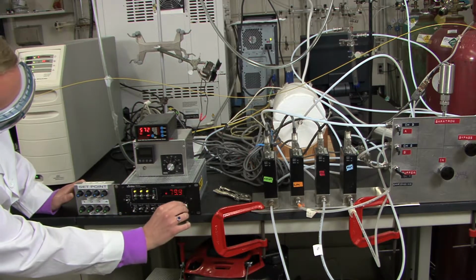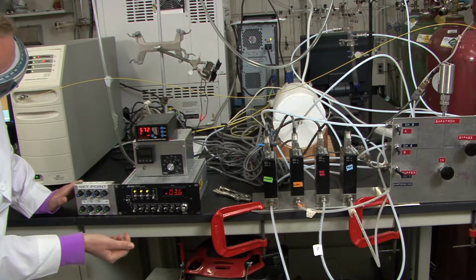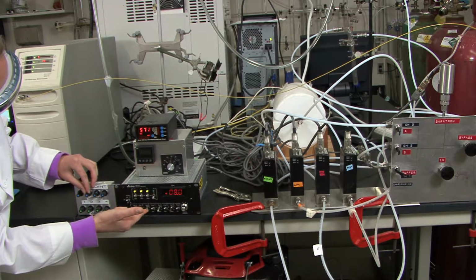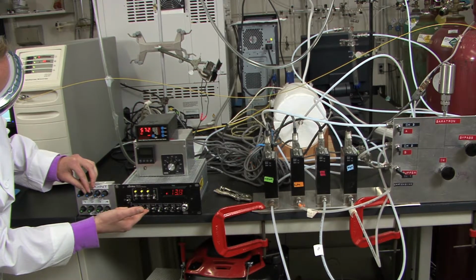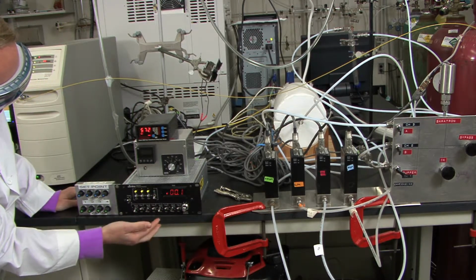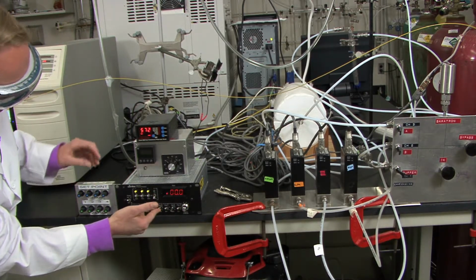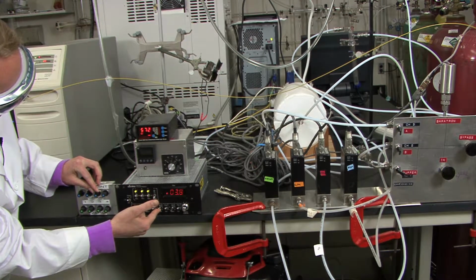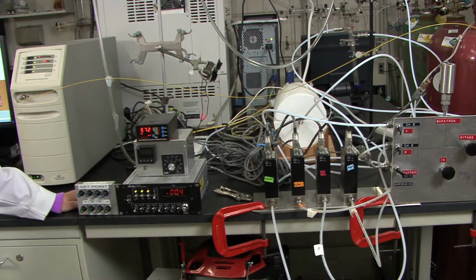You'll flip the knob of the channel display readout to 2, which will control the oxygen, and you'll set that point to 15. And then you'll change that readout to 3, which is ethylene, and you'll set that to 5. Then you'll need to go over to the gases and turn them on.